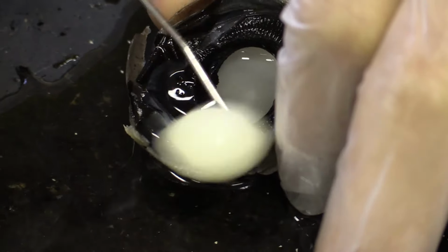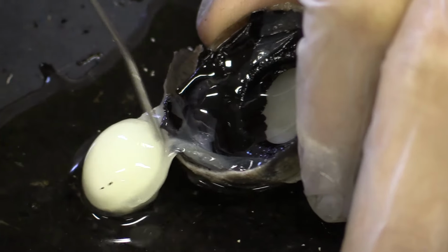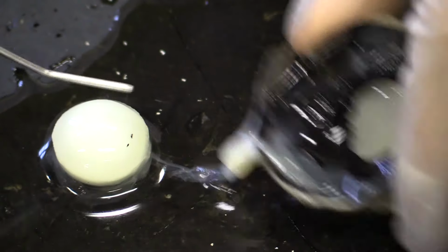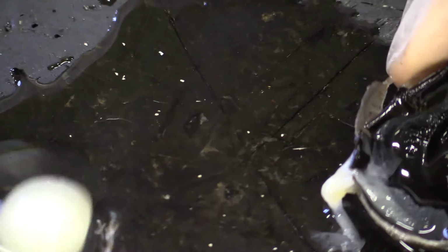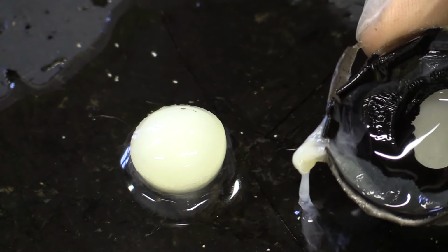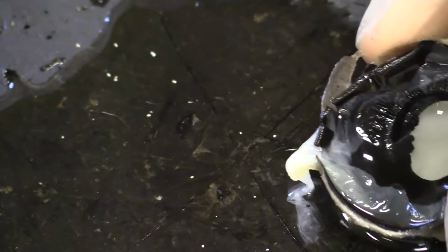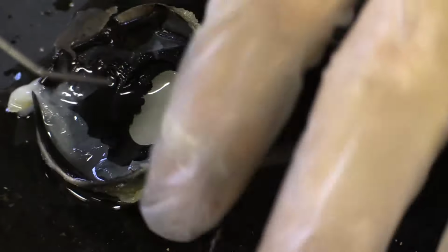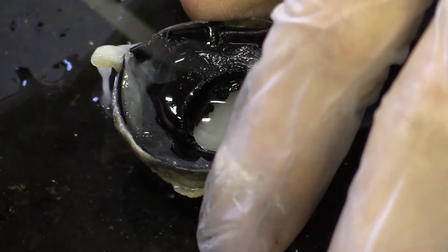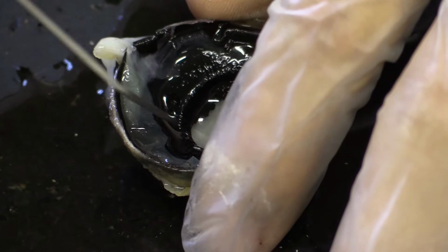Okay, now I'm just going to remove this very gently. This gumball structure, which normally would be very, very soft. This would be really soft, of course, because it needs to be moved and reshaped a lot of the time to refract light. Let's move that to the side. And in here, we have the iris, just medial to the ciliary body.